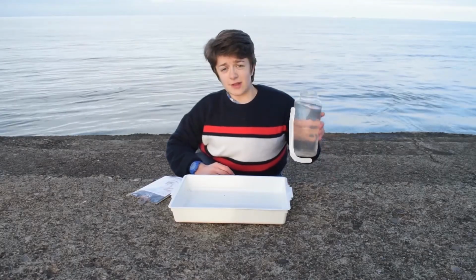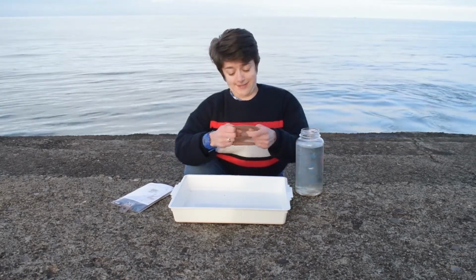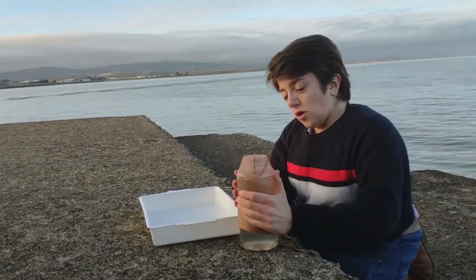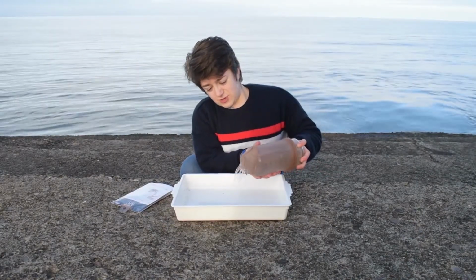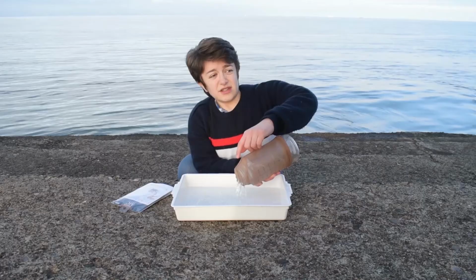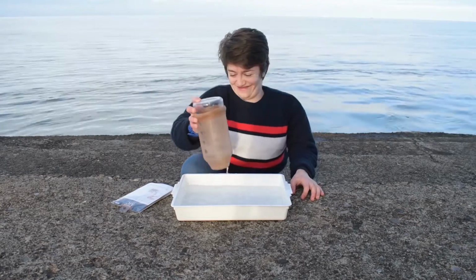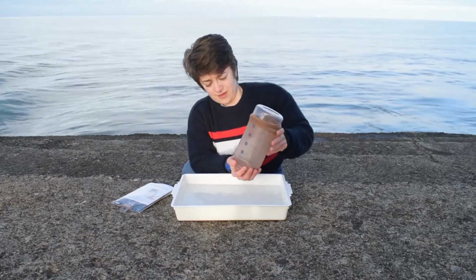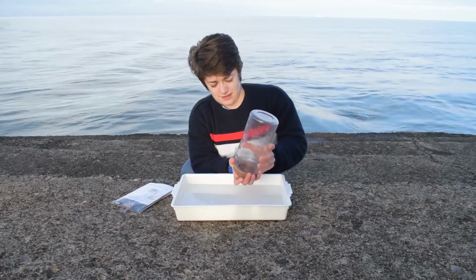All you need is a bottle of seawater and a packet of these. And what you're going to do is take one of the tights and put it over the top of the bottle like this. And you go and push it all the way down. And then you're going to pour the bottle of seawater into a container so that everything that's inside gets filtered to the side. That's it. So now that we have that emptied, we're going to very carefully peel this off and see what we have left behind in the tights.